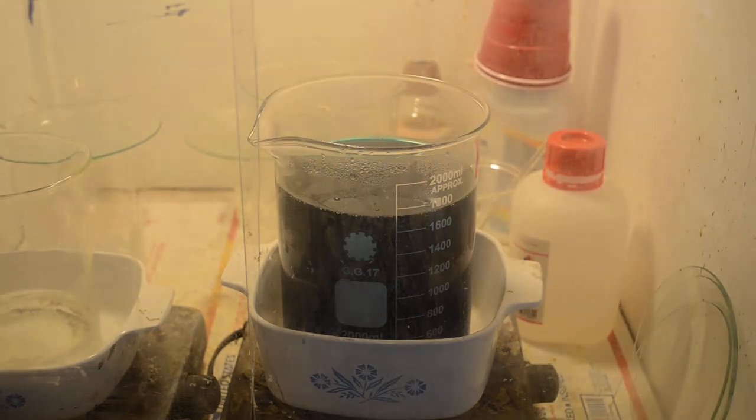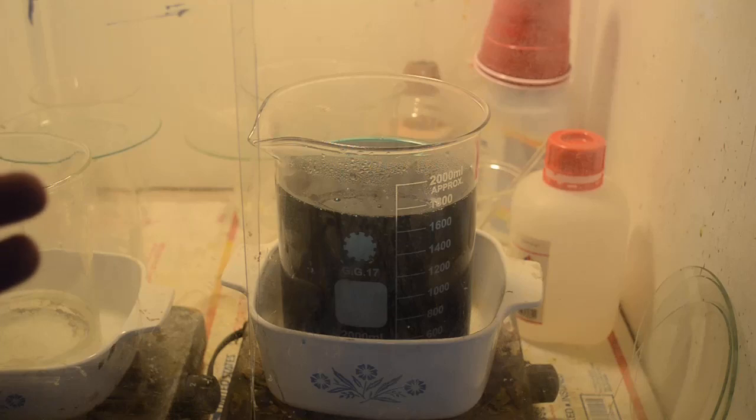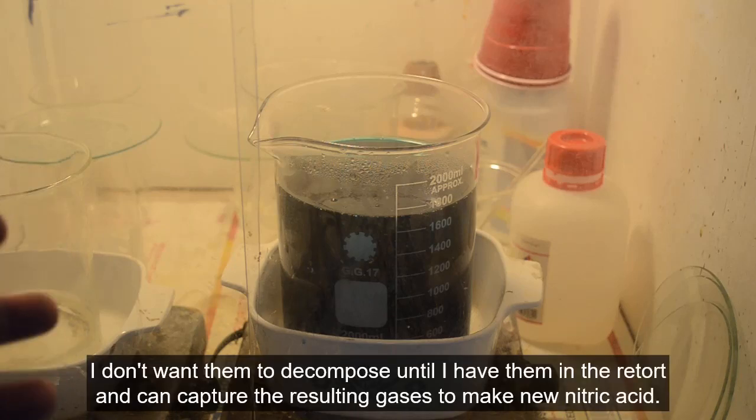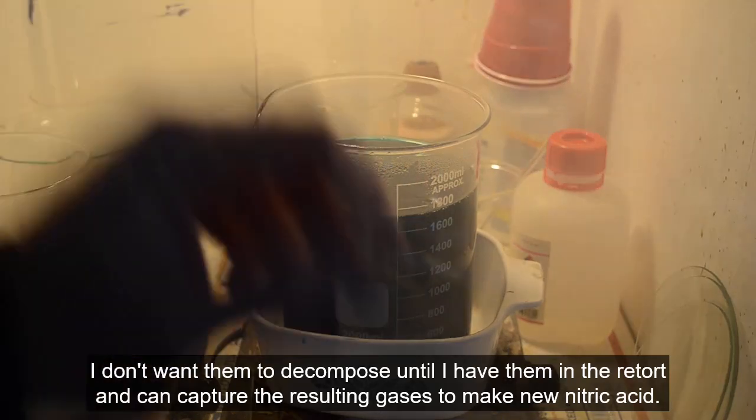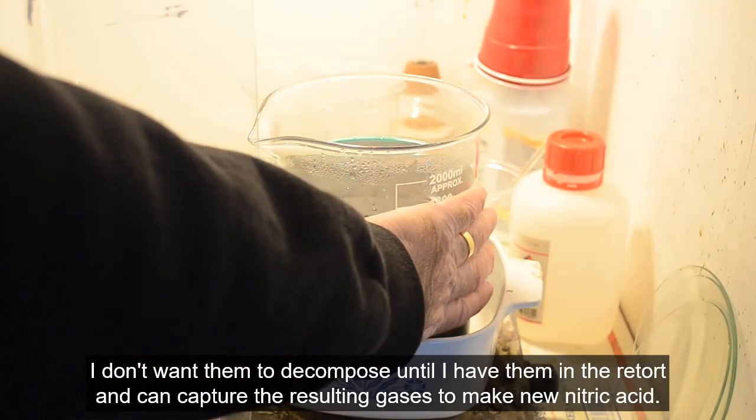So we'll see how it works. It may not work very well. Now, from what I'm reading, I don't want to get it too hot because the ferric nitrate and some of the other nitrate compounds will decompose if the temperature gets too high. So this is just warm, not hot.